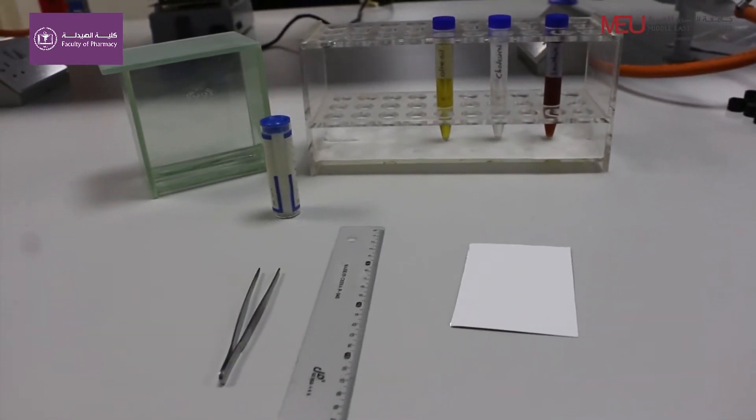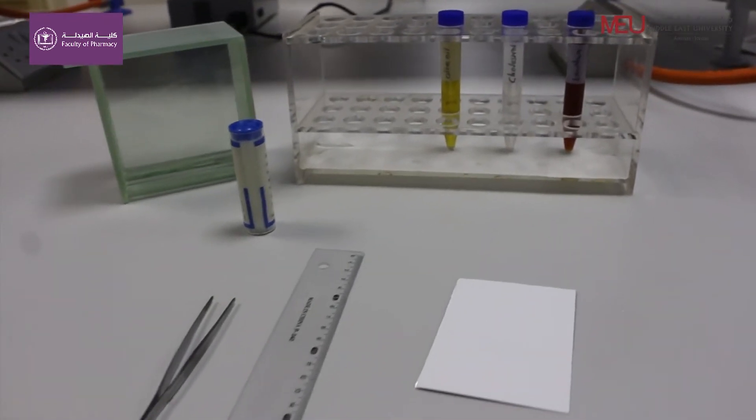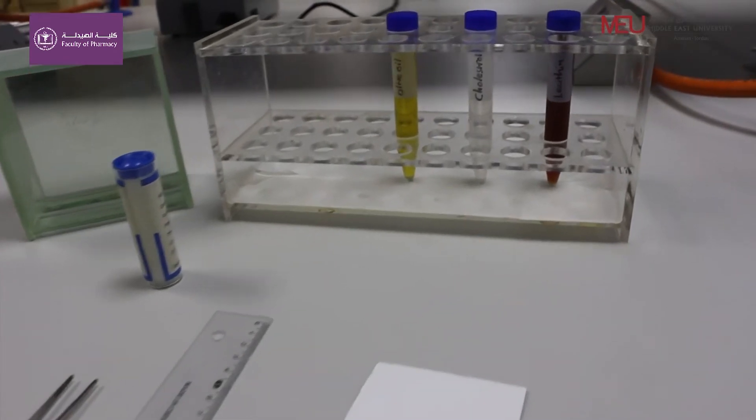In this video, we are going to show you how to separate and identify a mixture of lipids using TLC technique.